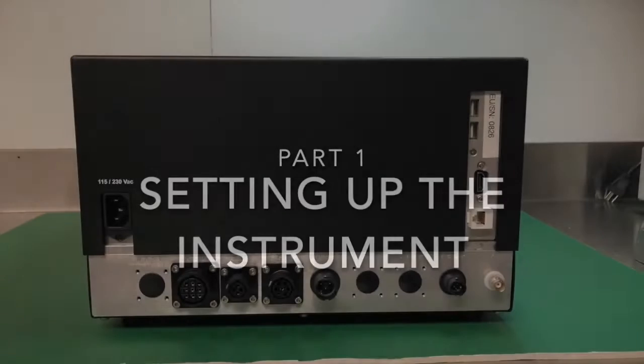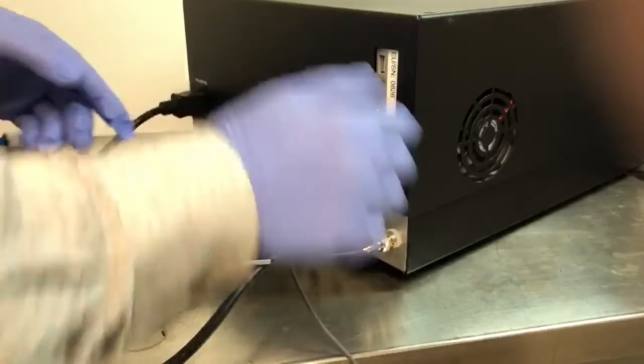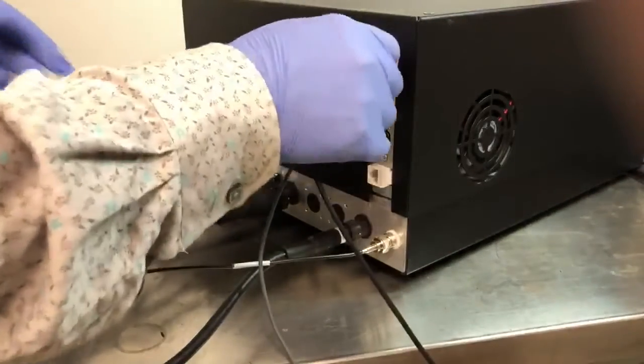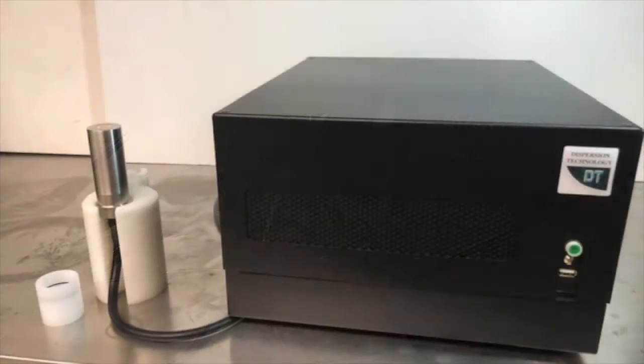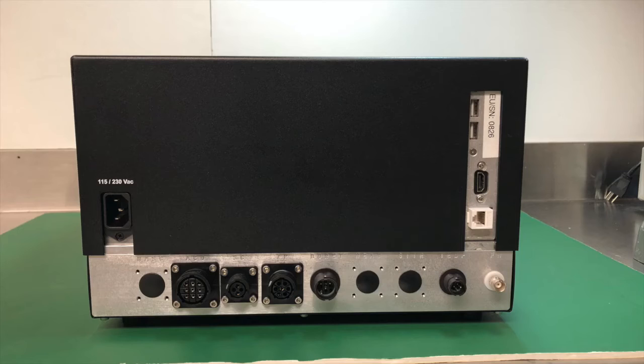Part 1. Setting up the instrument. There are several connecting ports on the rear of the electronics unit. The mouse and keyboard are plugged into the two USB ports located on the back. There is an additional USB port on the front of the instrument which can be used for a flash drive. The monitor is connected via an HDMI port located here, and the power cable is plugged in here.